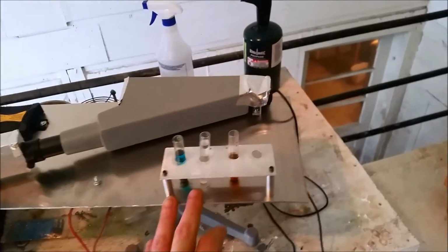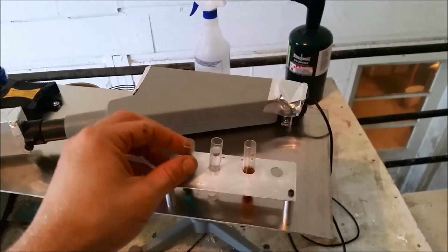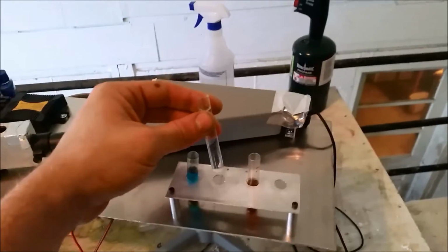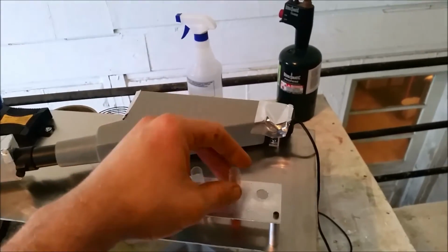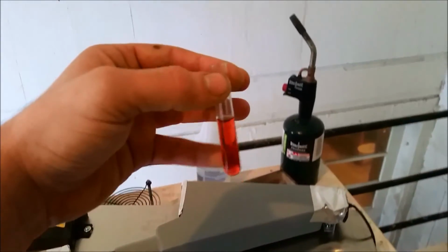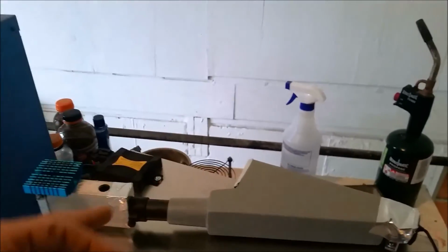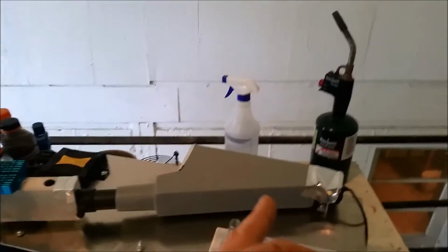I've got three samples loaded up here in my little test tube holder. I've got copper sulfate, sodium chloride, and cobalt chloride. Now this is the watered down version of cobalt chloride. If it's in an acidic environment, it's really dark blue, and I tried to use that, but it was just too dark, and this thing didn't quite produce enough light for me to get any sort of spectra reading.